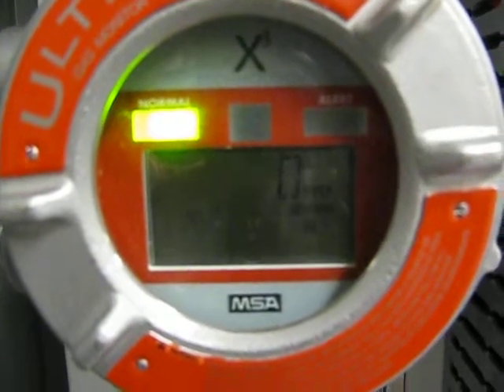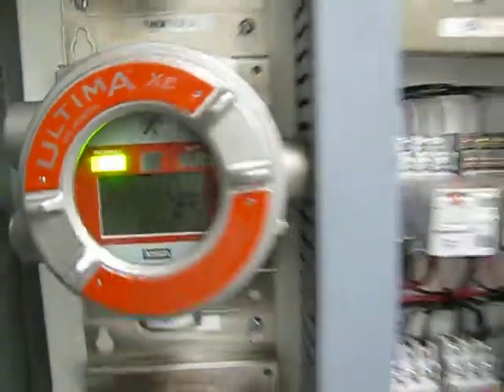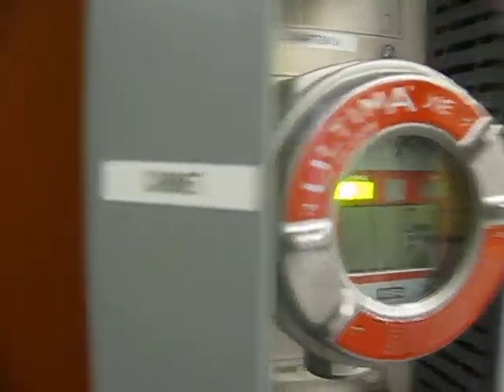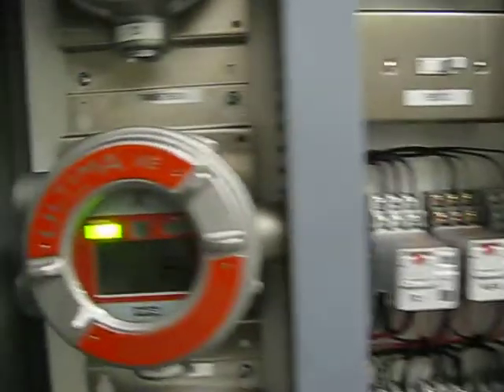The same sensors indicate gases present in three areas. The second area — the next one down — is for the gas cabinets inside the clean room. The gas cabinets contain silane as well as ammonia, NH3.